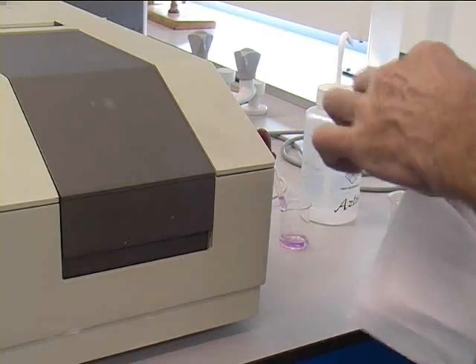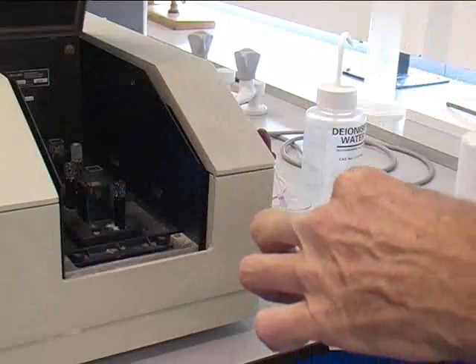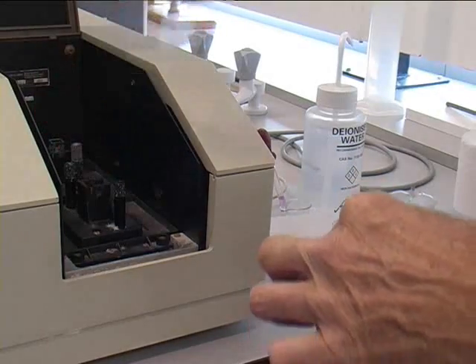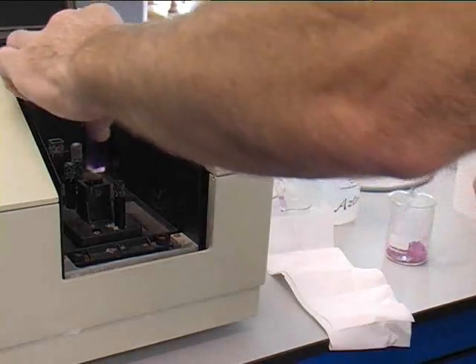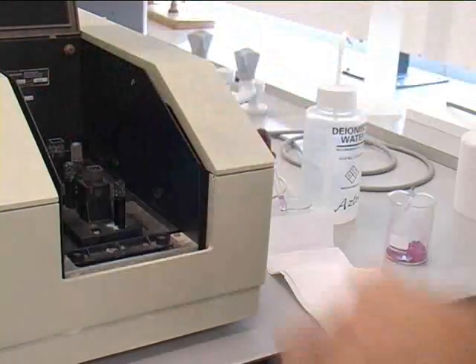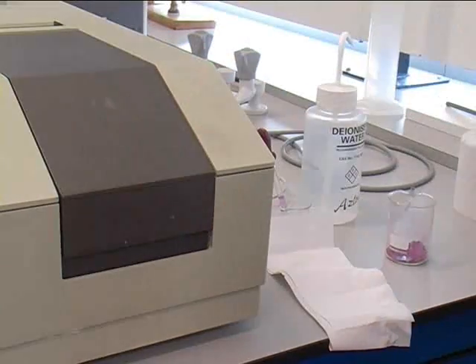Wipe the cuvette down to make sure there are no finger marks and place the cuvette into the first hole in the UV-Vis spectrometer. Still leaving one blank cuvette in the second hole.